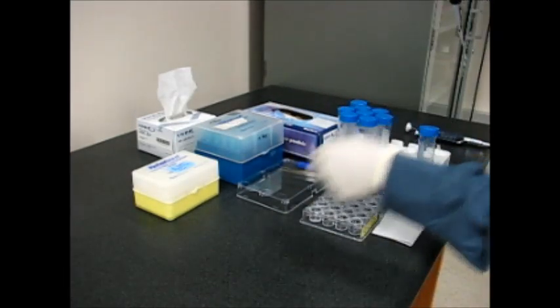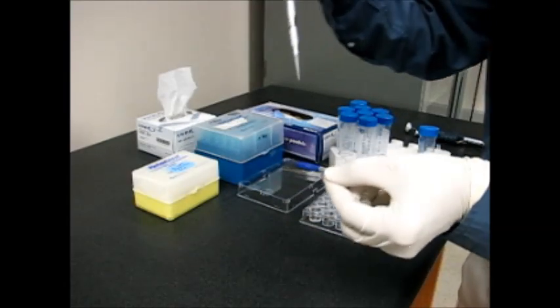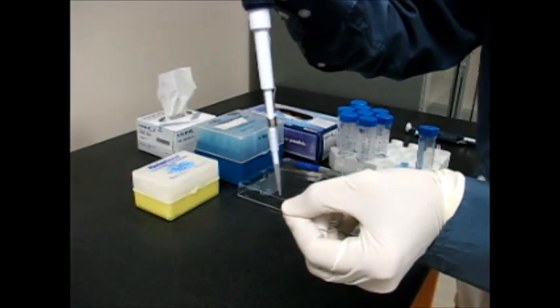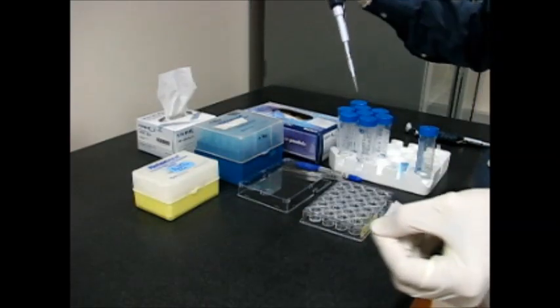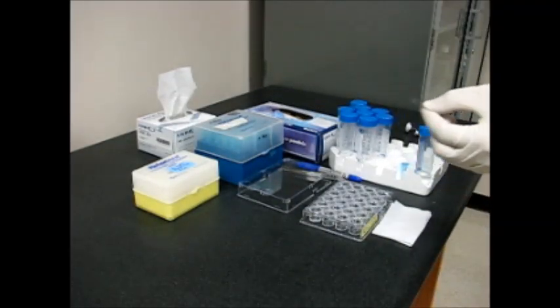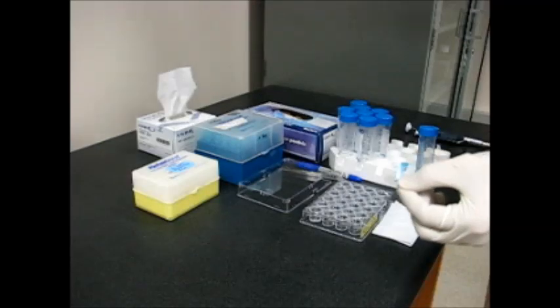Close the tube and then pick one of the siliconized cover slips and then add the three microliters of the protein onto the top of the cover slip. Now I change the tip and put a new tip on.